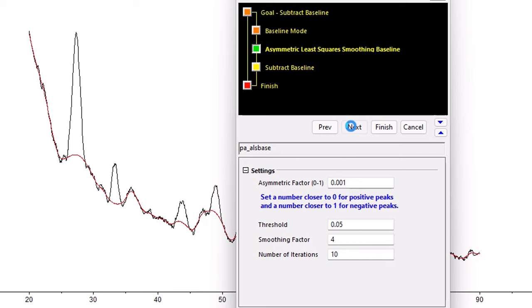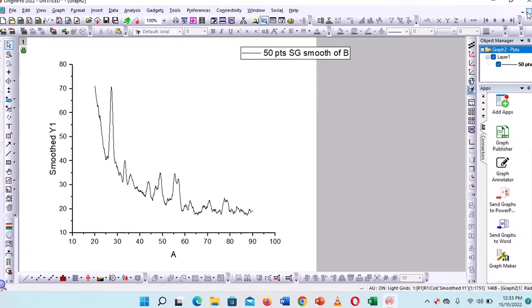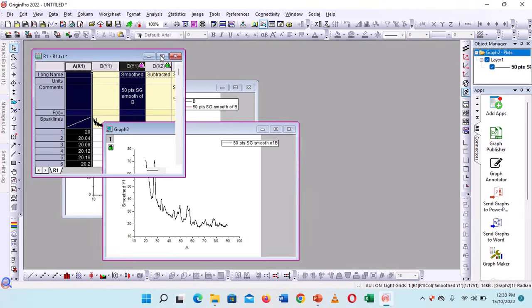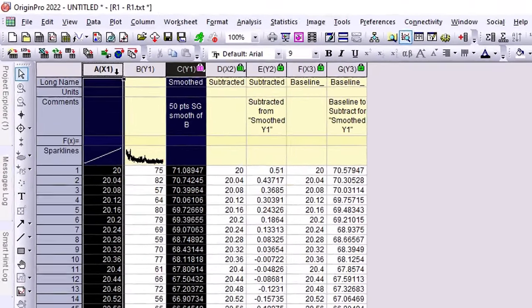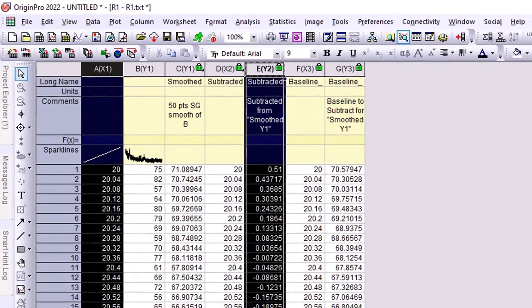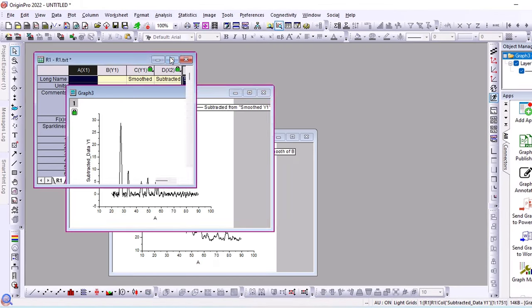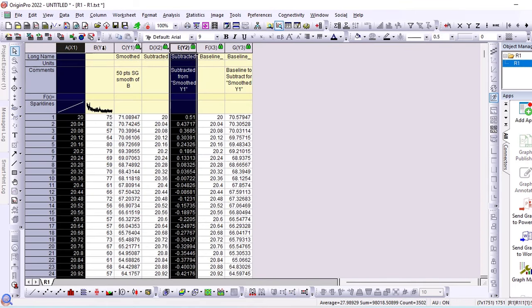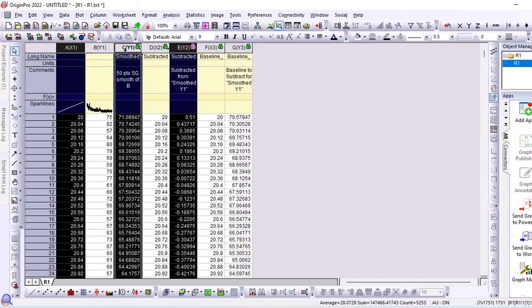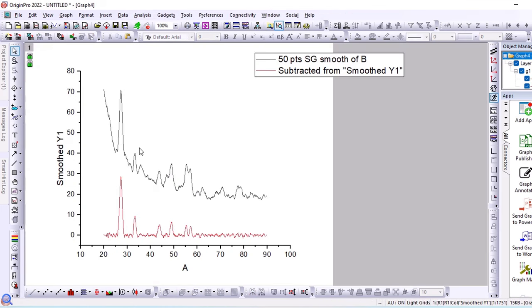Then next. And I will finish this. Now I have the data. This line is correct. And if I show you the two lines, the first data, which was smooth, this line is just smooth. And this line is corrected.